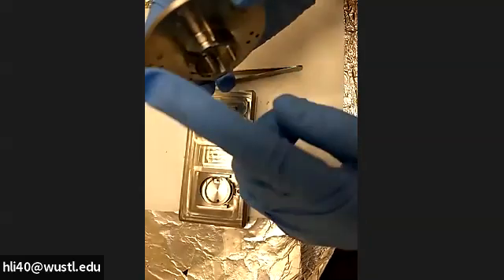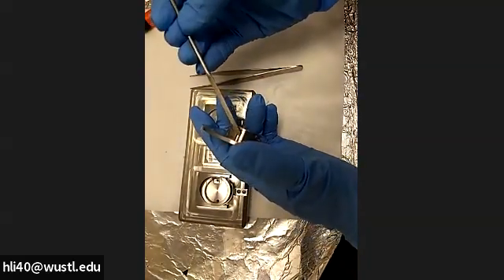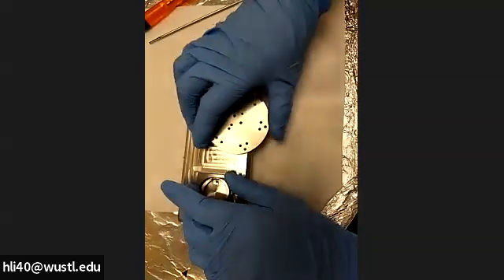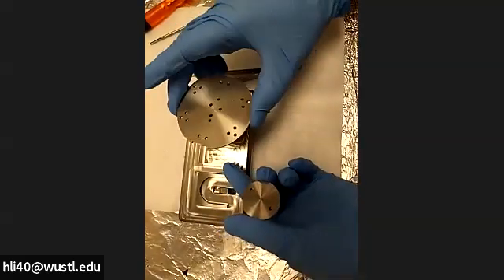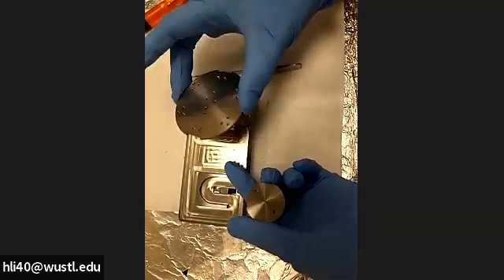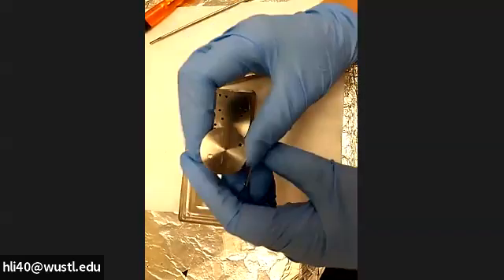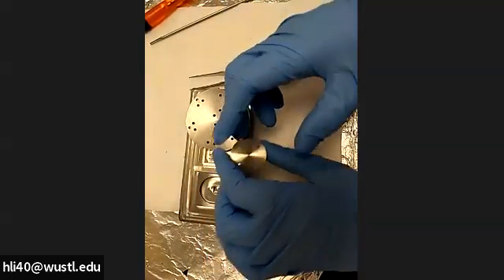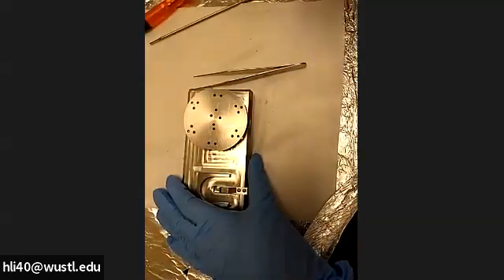You need to make sure the door is facing the main chamber, and the dimpled region must align with the screw on the stage. Normally we use the 60 millimeter holder for normal XPS — you can load a lot of samples but there's no room for tilting. If you need to do tilting or UPS, you must use the 25 millimeter holder or the full angular resolve holder currently in the chamber.